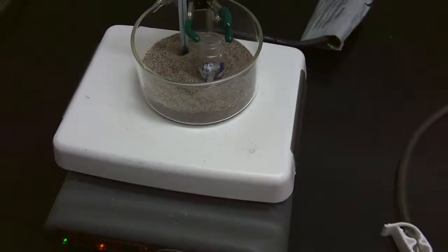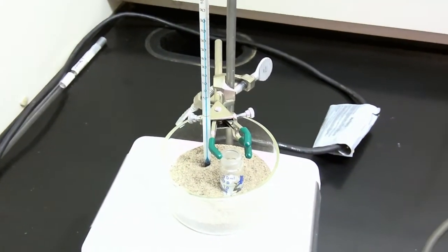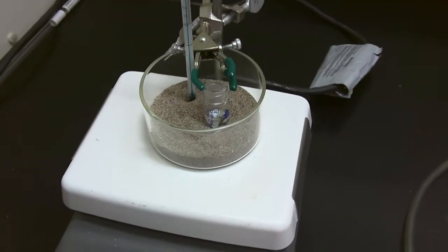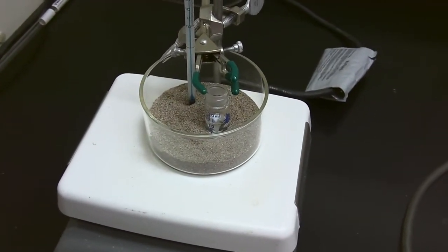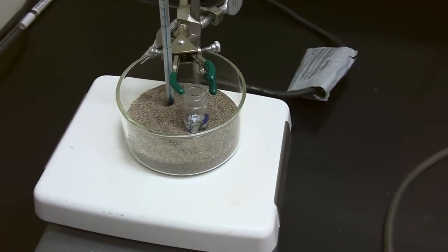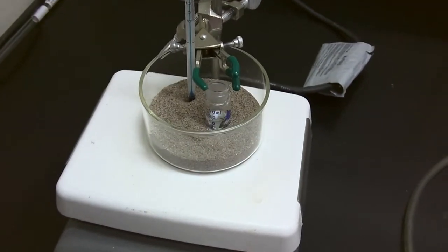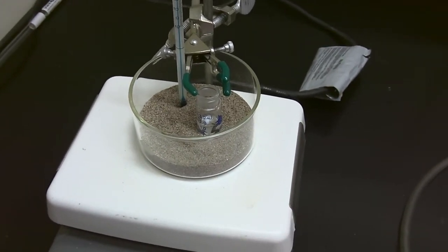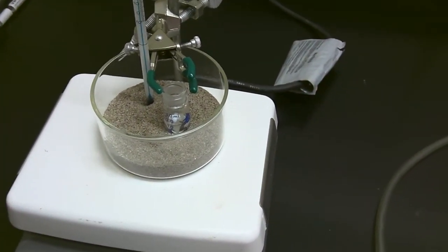Okay, so we've transferred our reaction mixture to a sand bath, and we're going to evaporate off the excess ethanol solvent at 80 degrees Celsius under nitrogen. And we'll resume once we've completely evaporated off the majority of our solvent. We're concentrating to a final volume of about 0.25 milliliters before we do the resulting quench and extraction.